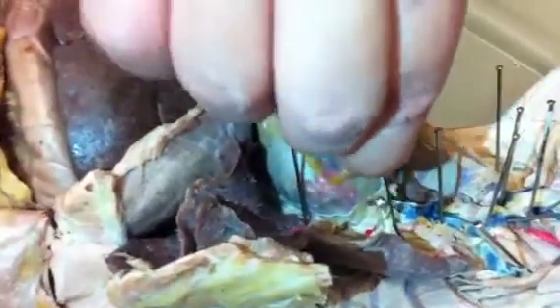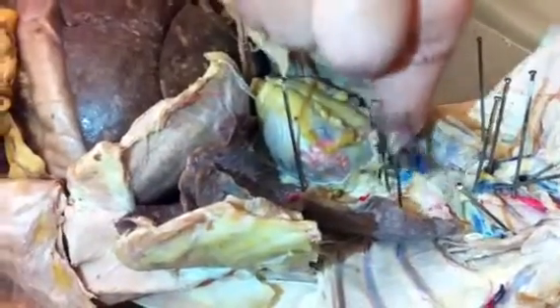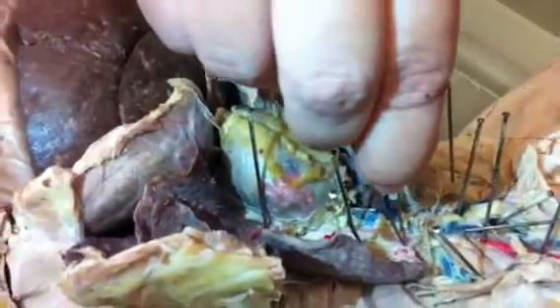All right, off that there's only two blood vessels. This first one is the brachiocephalic. In the cat it's a little different. It splits into two, right here. And those two are what? The two carotids come off.